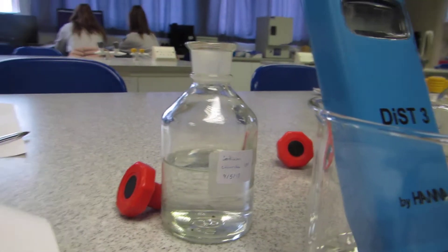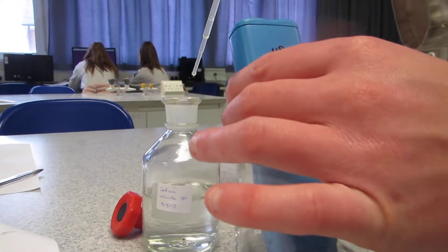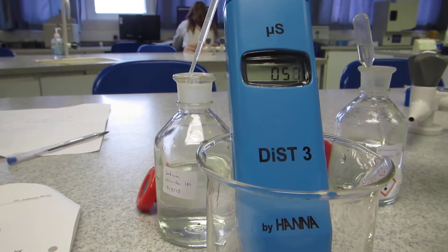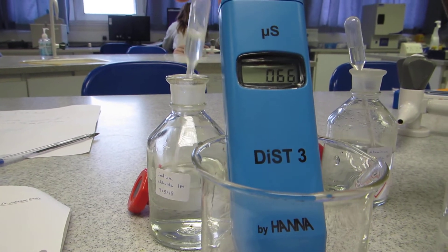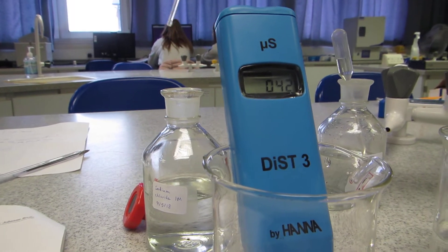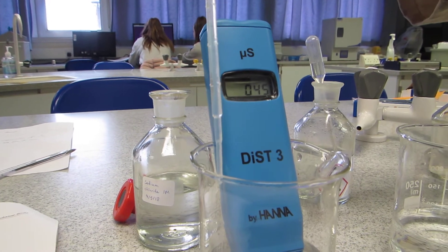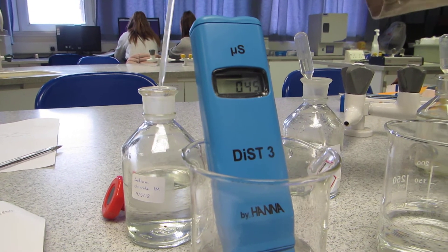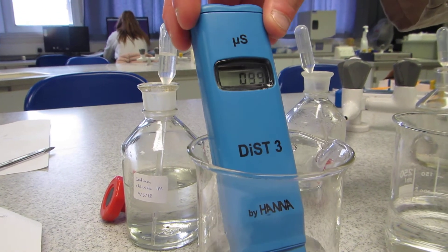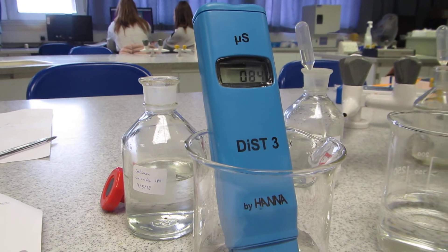Once it settles, I add one drop — this is the sodium chloride — add one drop, give it a little stir. You can see that the conductivity is increasing. Once it settles I can add a second drop, give it a stir. I'm going to repeat this until we have ten drops.